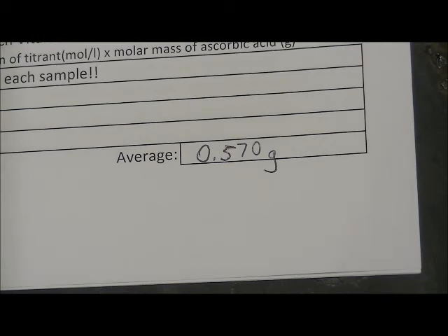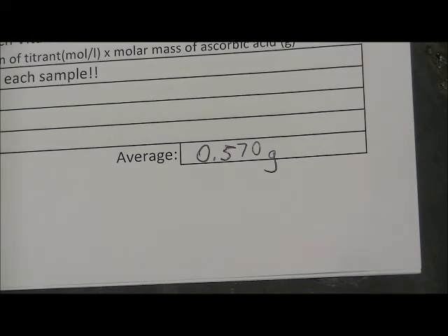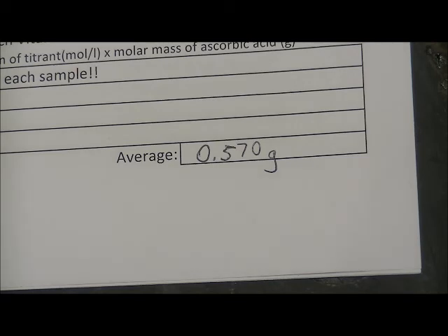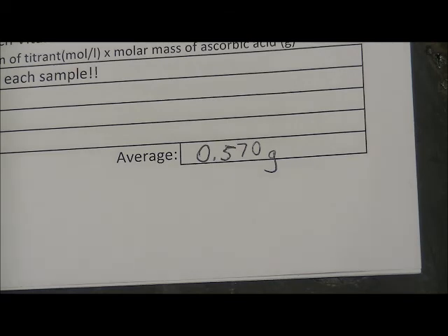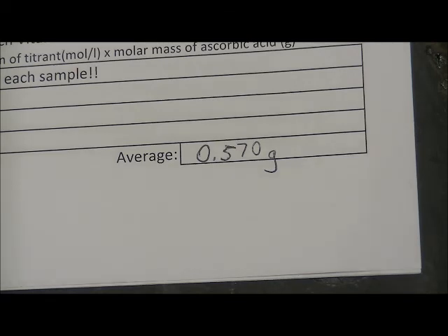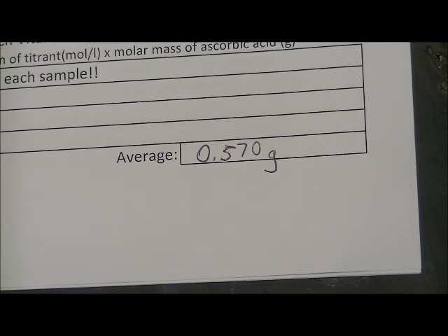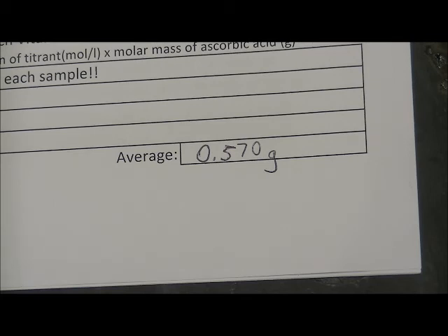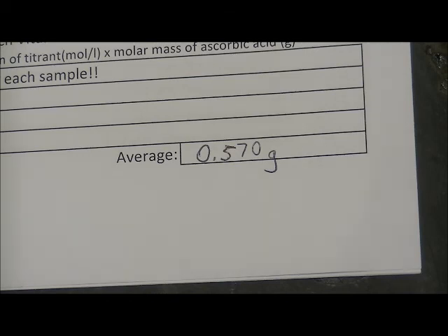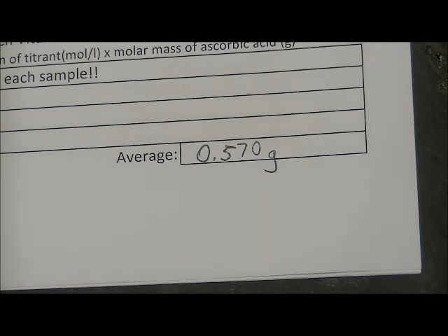Without showing all of the calculations, I did complete them all, and my result was an average mass of 0.570 grams of ascorbic acid in each tablet. I hope your calculations come up with the same result.